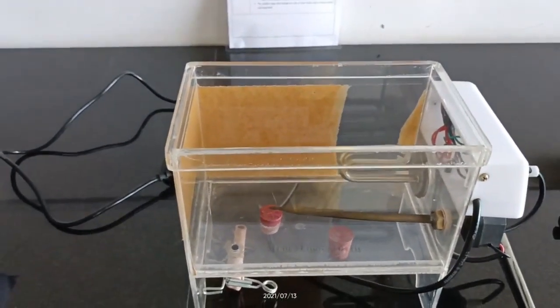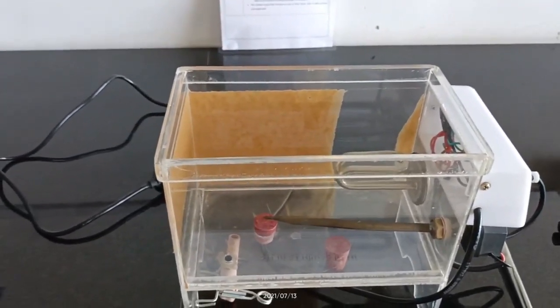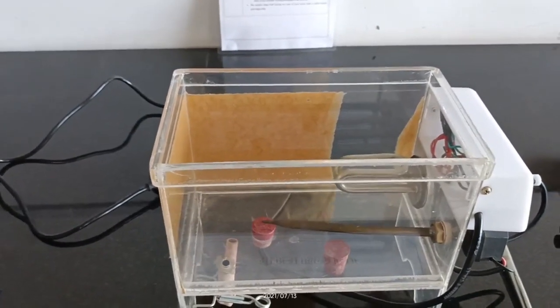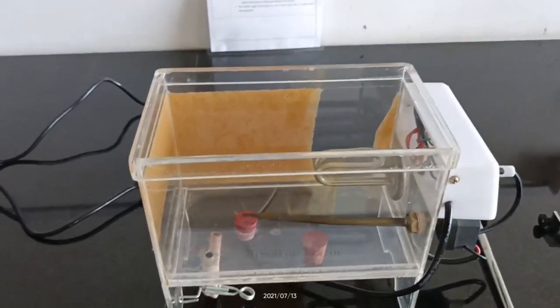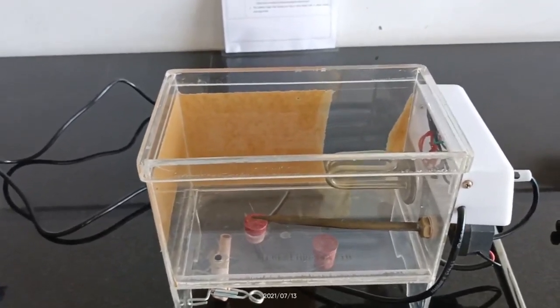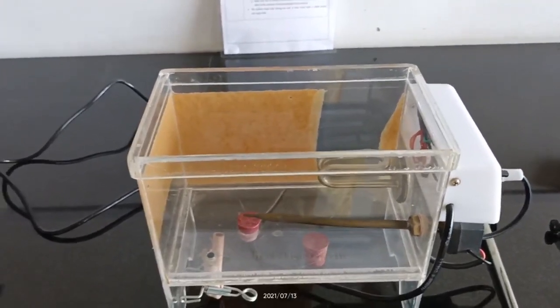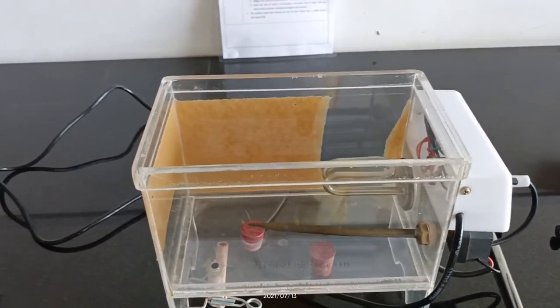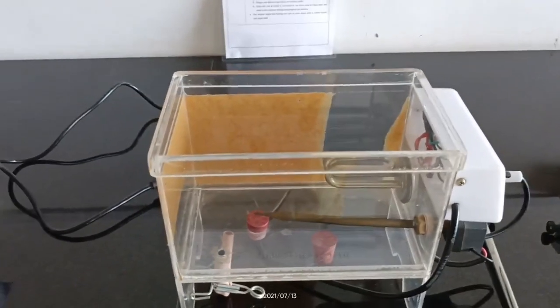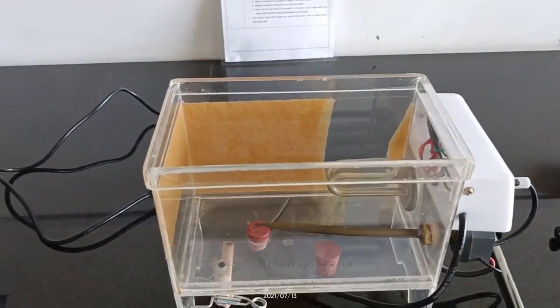It was discovered first time in 1921 by the scientist Otto Loewi. It is the most commonly used instrument for pharmacological research purposes.